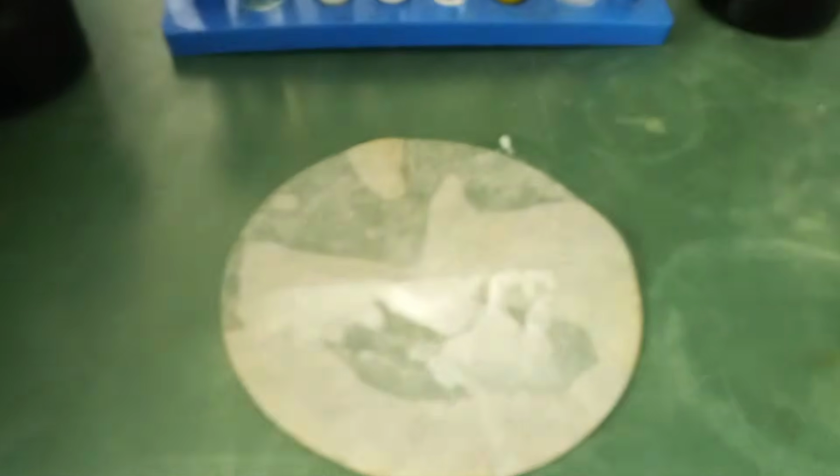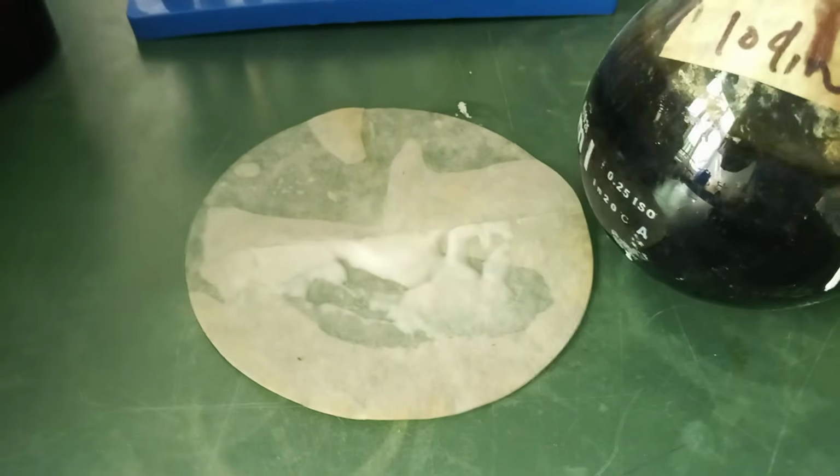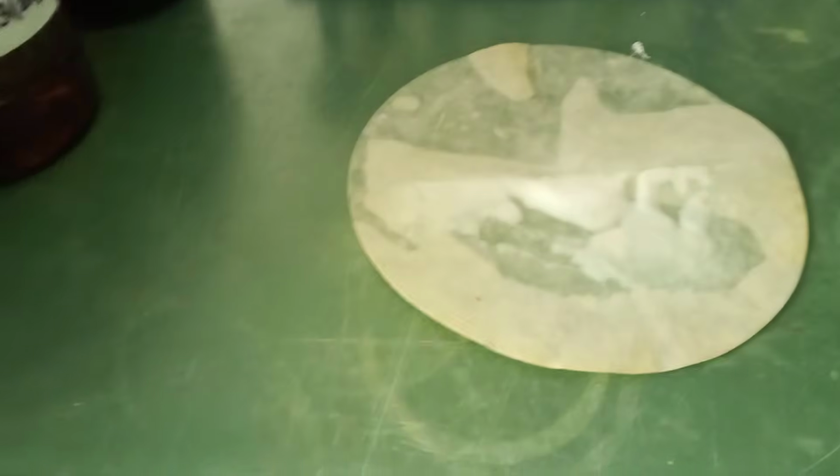Yes, that's our starch. So we are going to collect it and put it in a test tube, and then add few drops of iodine to it. All right, hold on. This is iodine. Can you see this? So we add few drops of this to this. Okay, and then you see the result.